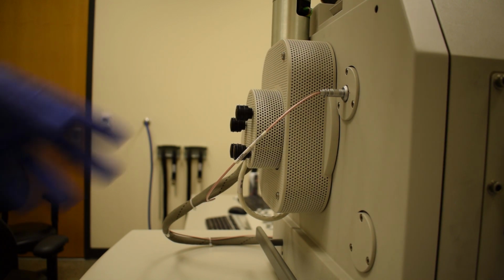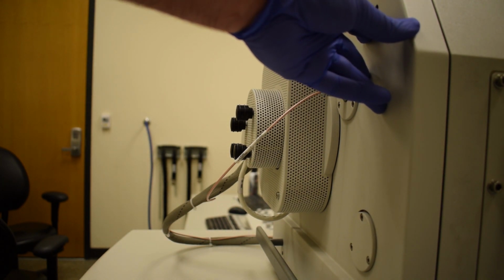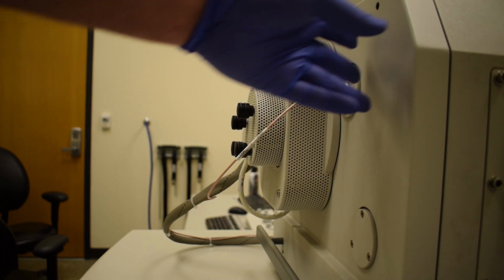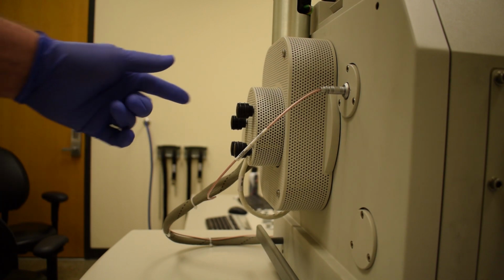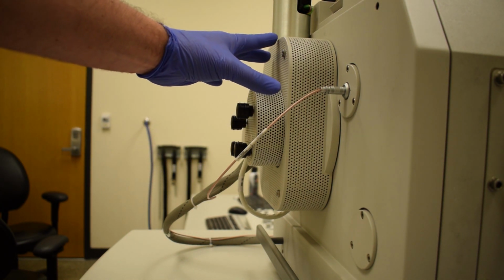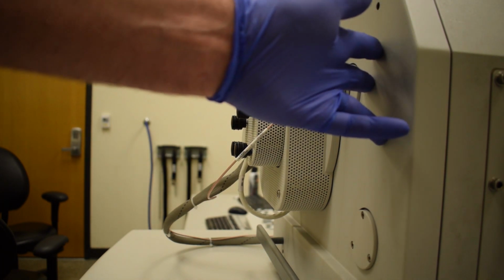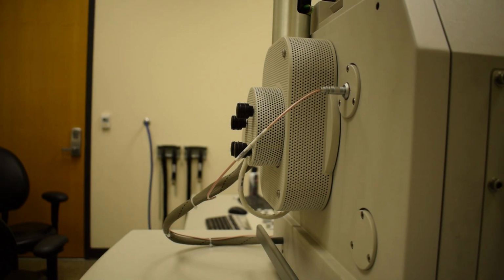Now, while the chamber is pumping, you may have to gently push on the door of the microscope to get this chamber to seal. You should not have to push hard, and you should also avoid pushing on the stage feed-through controls. These can be damaged if you push on them, but feel free to push on the flat surfaces of the door or on the handle at the bottom of the door to get the chamber to seal up.